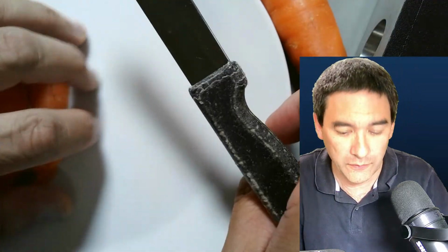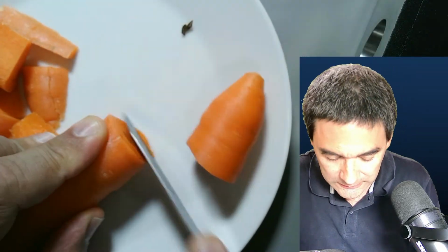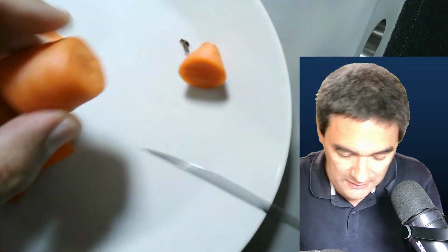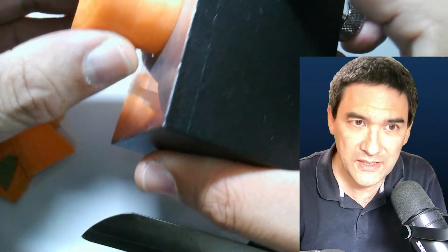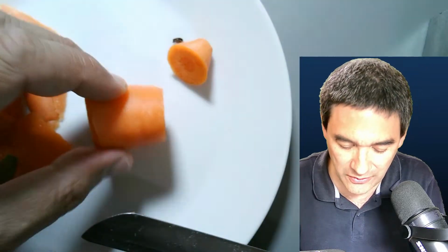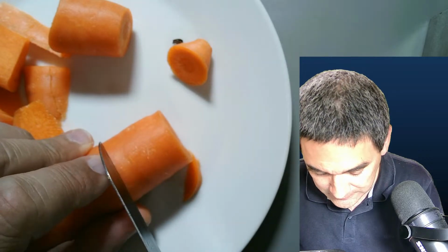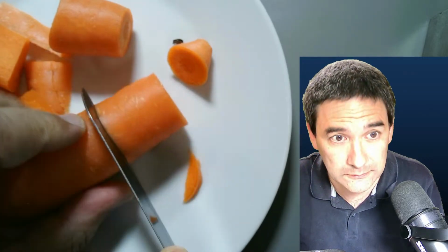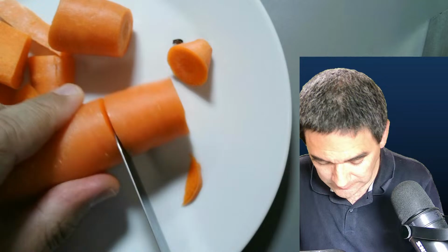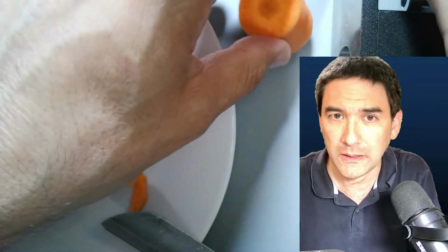I'm going to remove all of those carrots here, and I'm going to try to do it like this, and I have to see if it fits. You see it on the bottom here. It's too thin. So let's try different. Let's try it a little bit bigger. So, and now I have to cut it into shape a little bit, and I think I'm going to increase the height of the camera again.